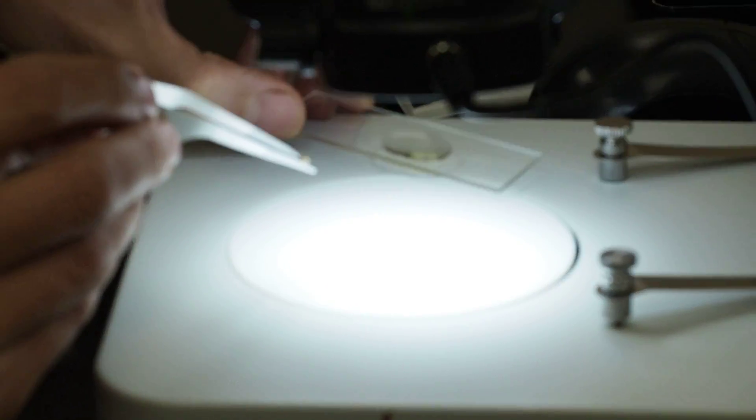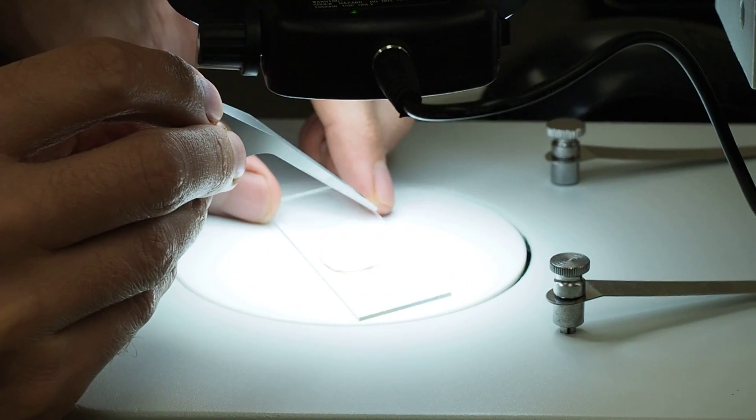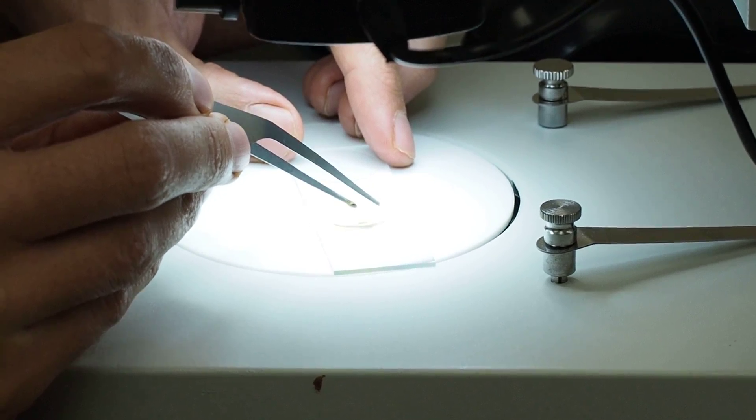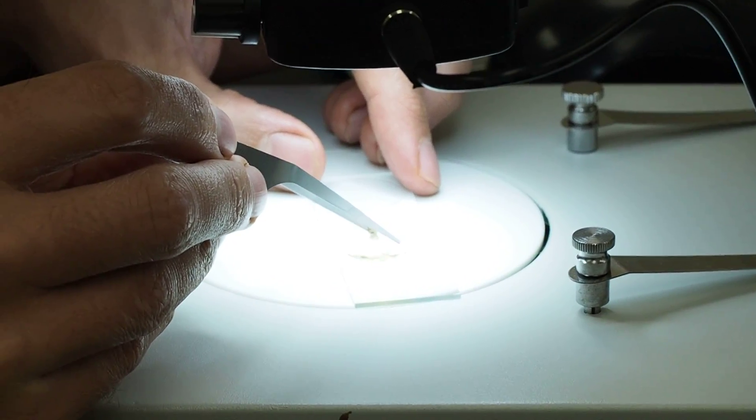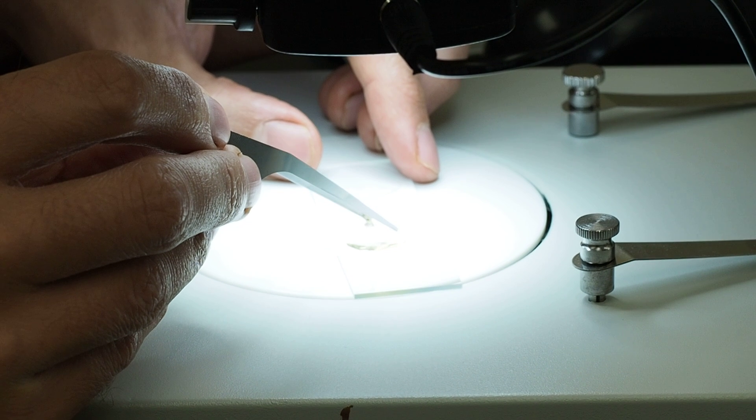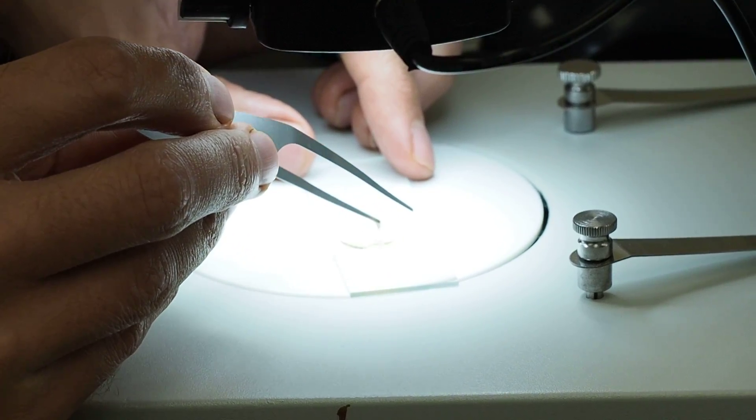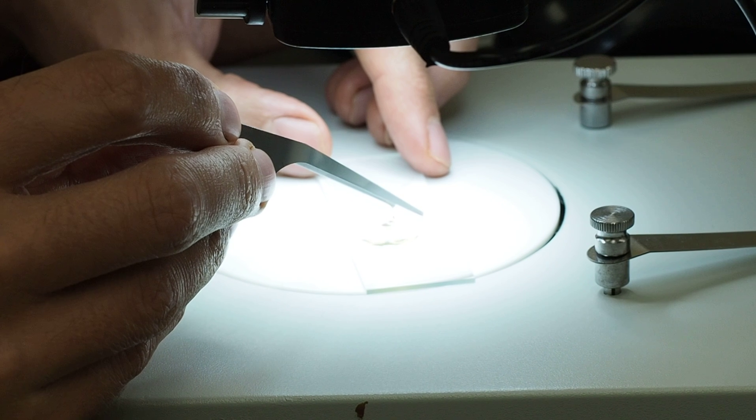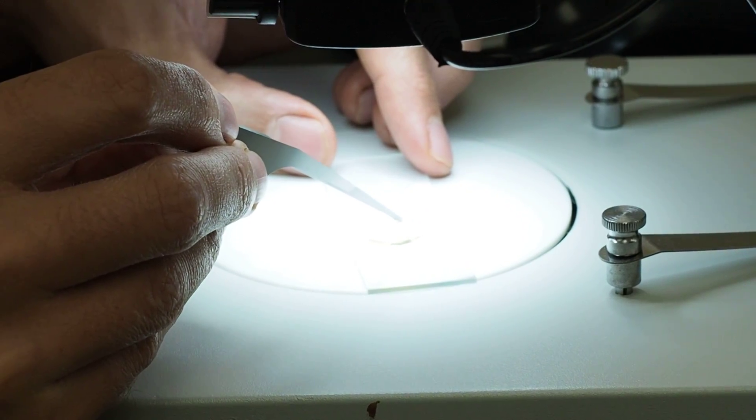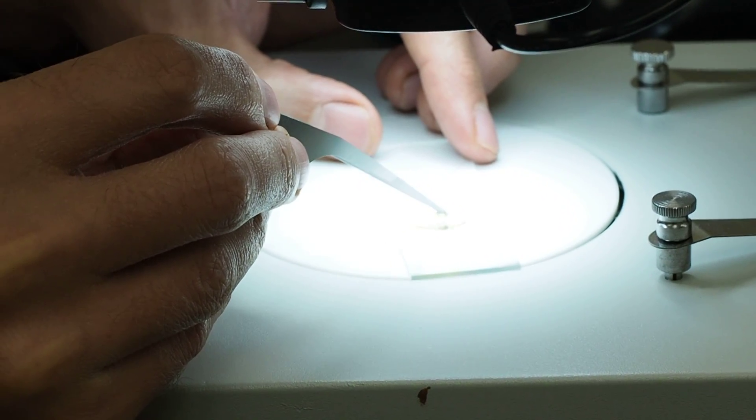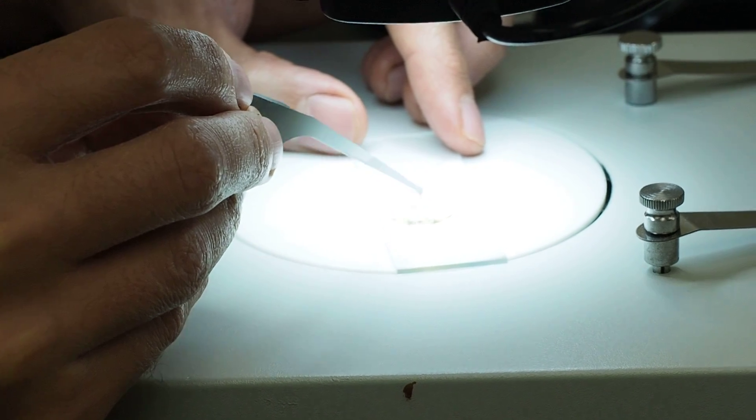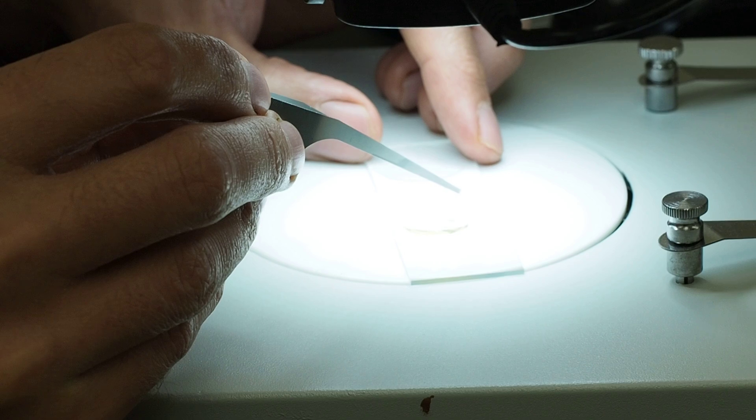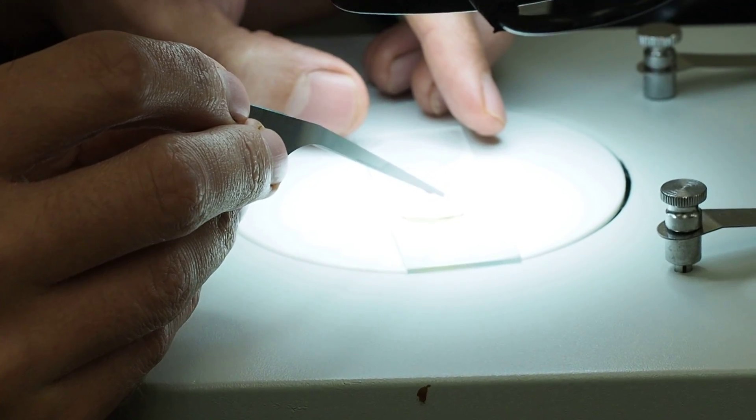Without dropping anything, it should stay on the tweezer, held in place by a little Canada balsam and clove oil. And just lay it in, lay it in there very carefully. There it goes. So now it's in the droplet. I'm trying to get it close to the center of the droplet, and it's on its side right now, which is fine.